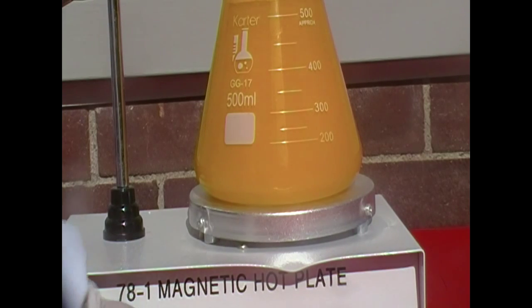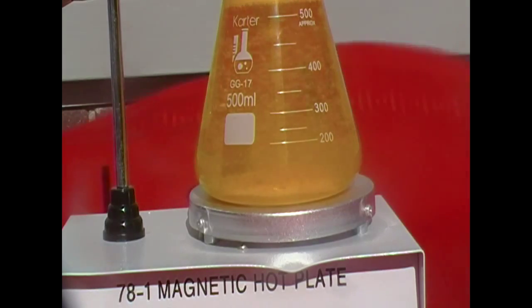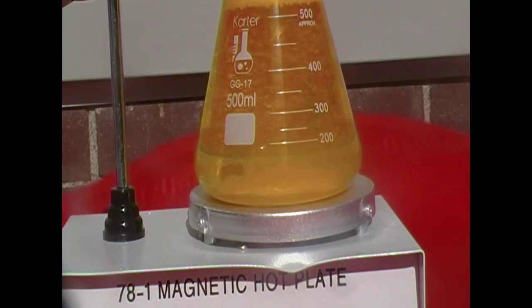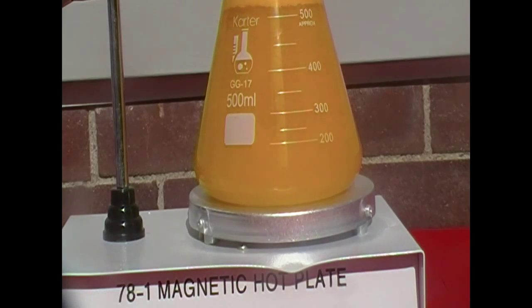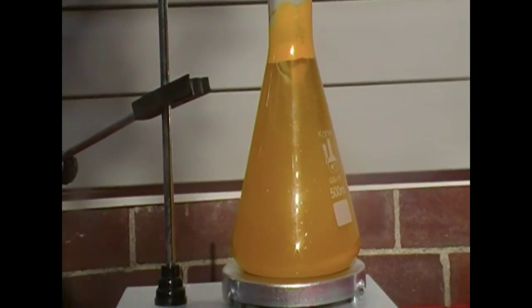And now, just for another quick little disclaimer. When you're done generating the lead iodide and the potassium nitrate for this little double displacement reaction, please do not attempt to even think about throwing this stuff down the drain, because, like I said, all lead compounds are obviously toxic, and that could eventually work its way into the public water system and poison about everybody in my town. So please don't do that at all if you attempt this. Just give it to a designated company to get rid of it for you. They have special companies that drive those hazmat trucks, and they will take it off your hands and dispose of it properly.